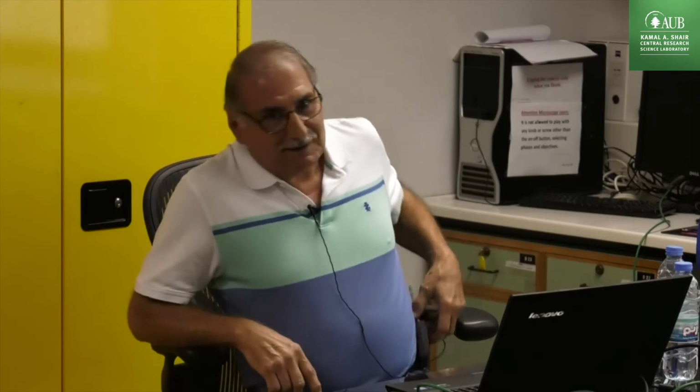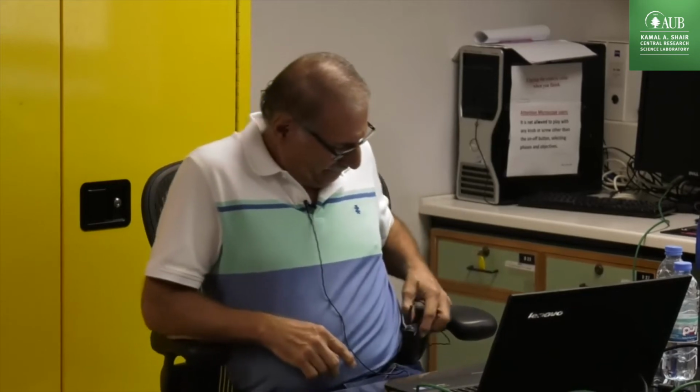I'm going to close this because I don't want to have a problem. So let's continue with this. I think this is the only thing. This is how to adjust the limits and things like that. Now let's see if we start from the beginning. How can we start with analysis? Okay, so I'm going to get out from here.